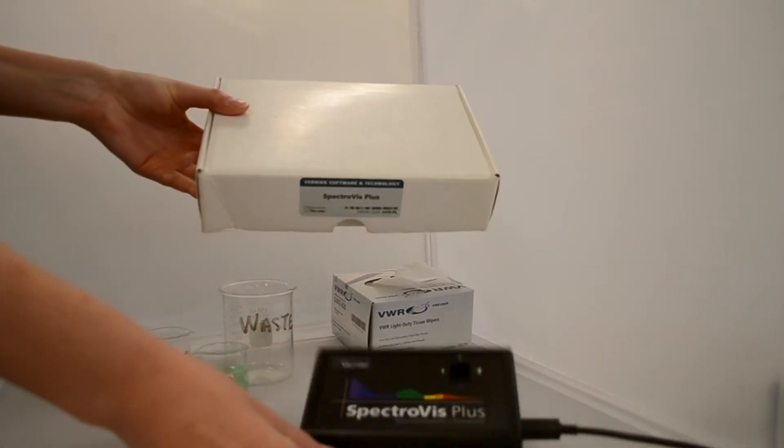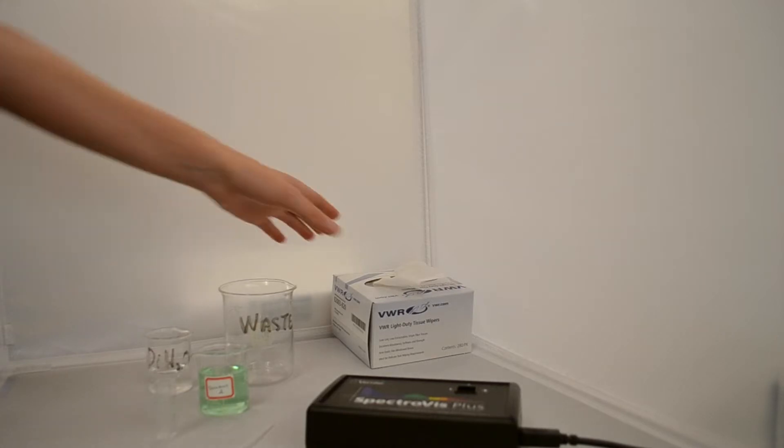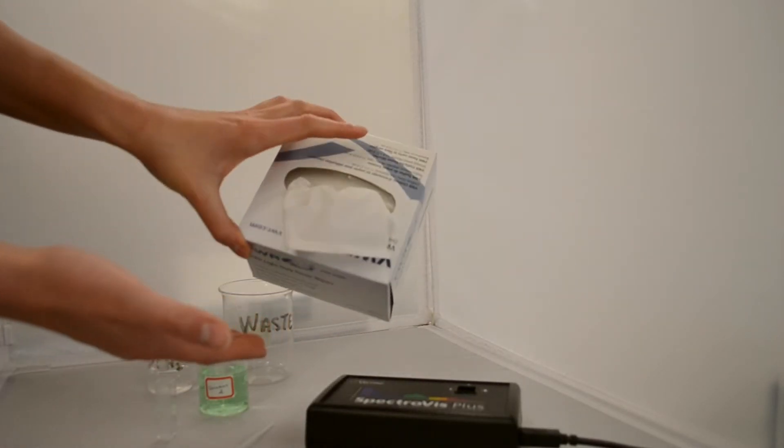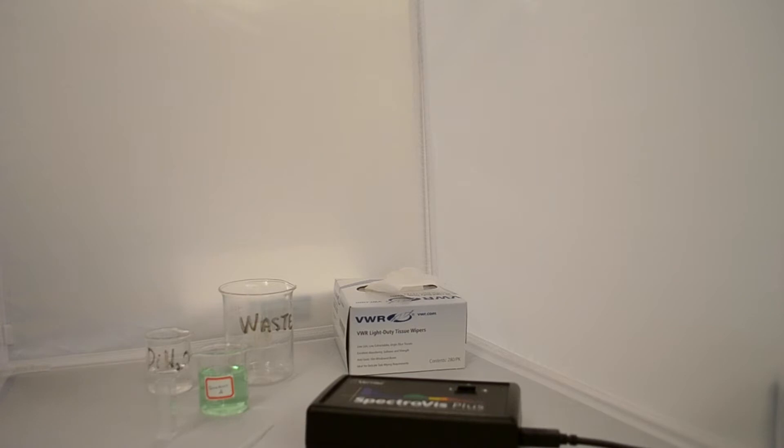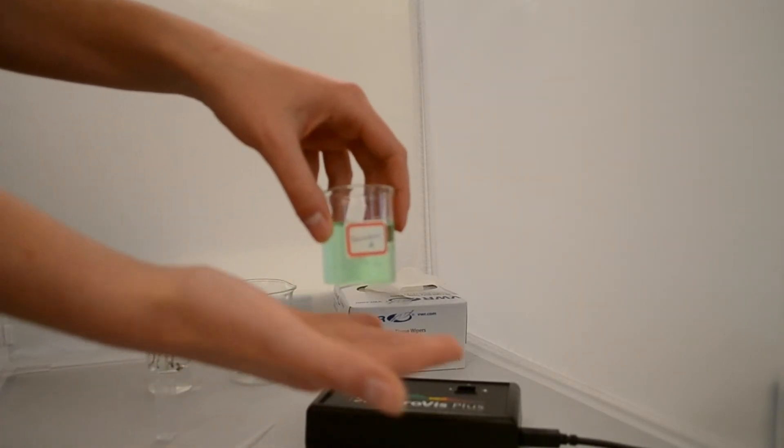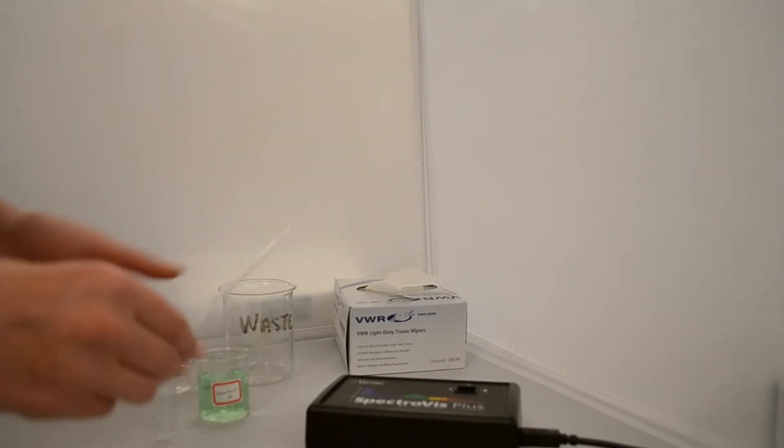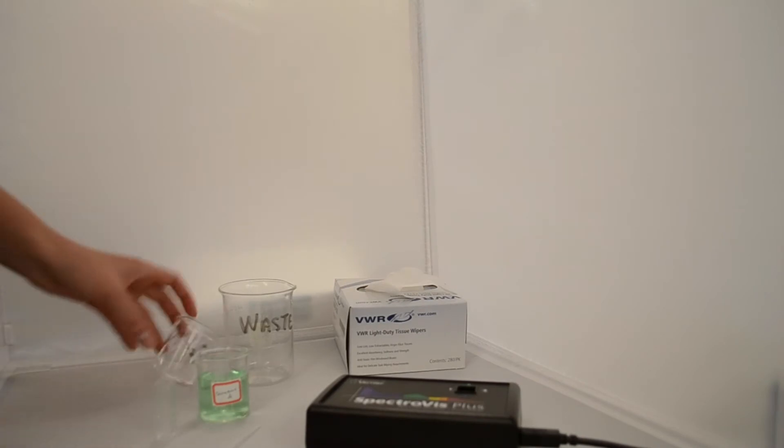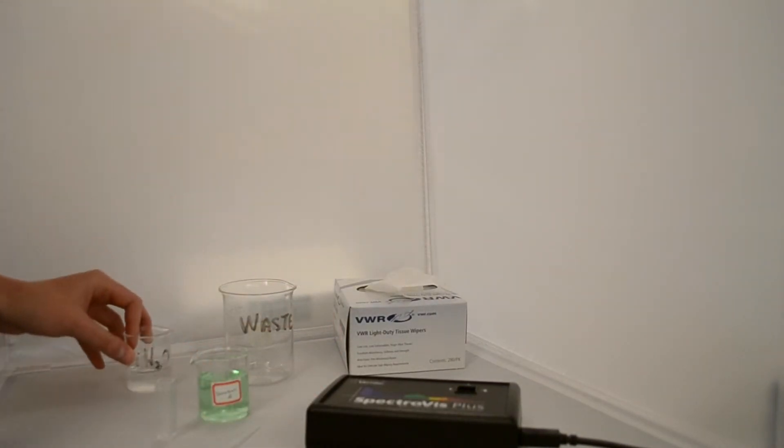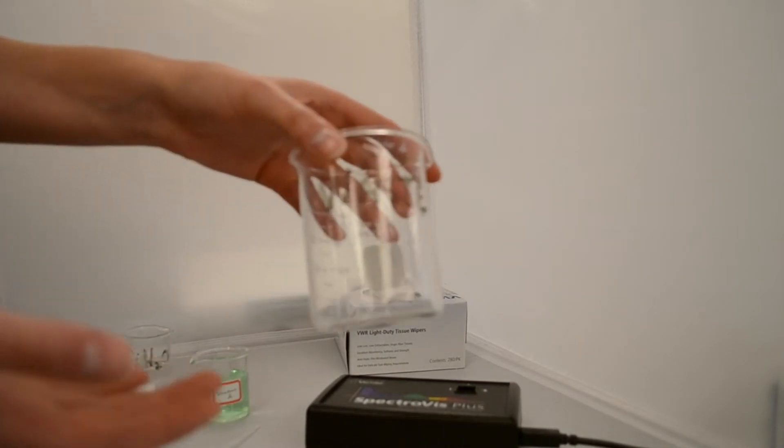A spectrophotometer kit, a cuvette, Kim wipes, a computer with the application Logger Pro, the solution to be analyzed, a transfer pipette to transfer the solution, DI water, and a waste beaker.